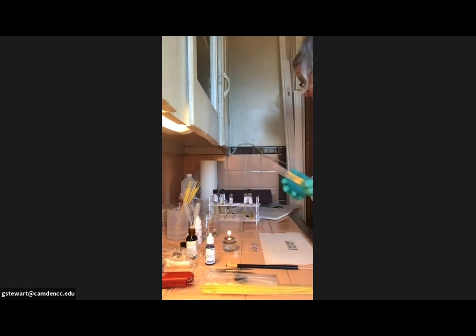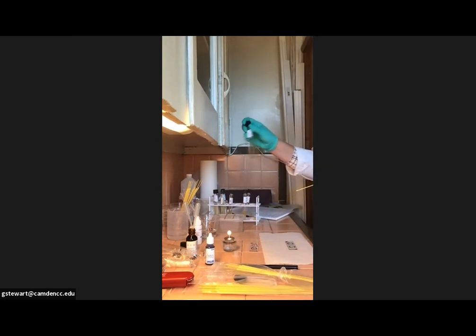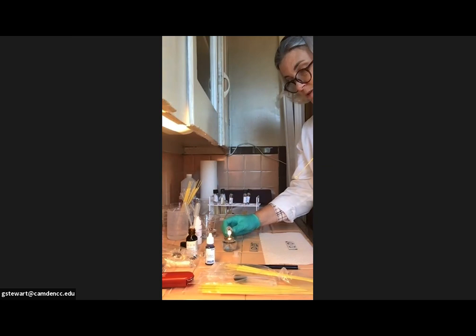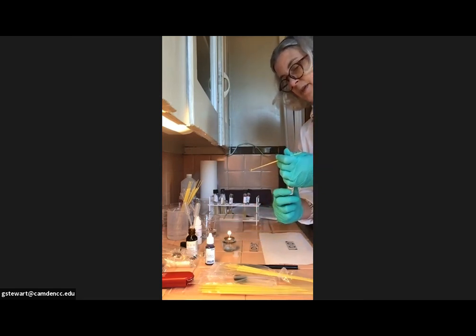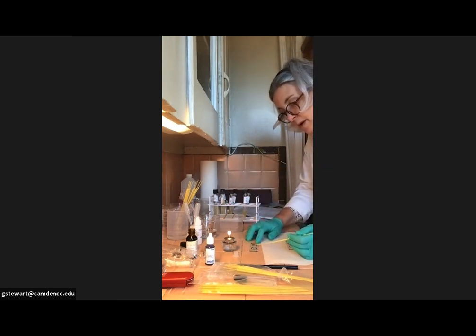Now, letter B is supposed to be the staph epidermidis, so I'm going to withdraw another single loop here and get my staph epi container, my broth culture from yesterday, give it a little shake, a little swirl, so the bacteria are all nice and resuspended. Twist the tube, flame the top, almost forgot. Insert and get a loopful of bacteria, flame the top, cap the tube, put the tube down, again moving it to the back of the rack and placing it on slide number 1, circle B.